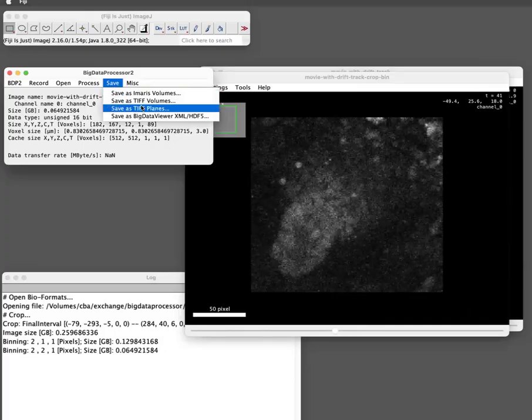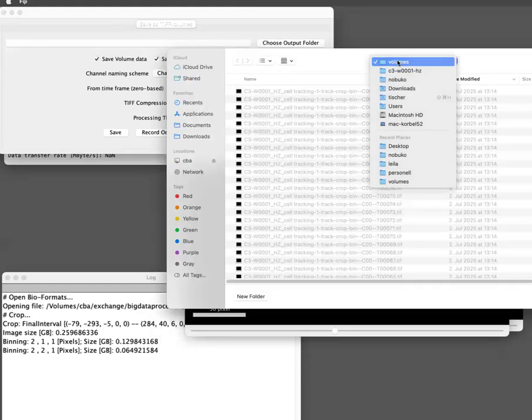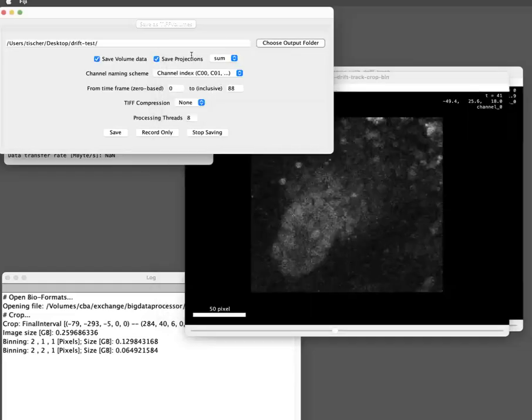And I want TIFF volumes. So output folder. That doesn't matter. Well, okay, let's do desktop, new folder, drift test, create, open, and file name, we can just call it something, movie. And we don't need projections. We want to save all the volumes, all time points, no compression. You can also compress. And then we say save.